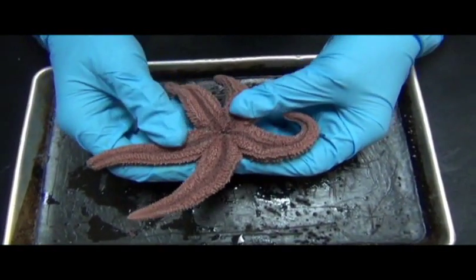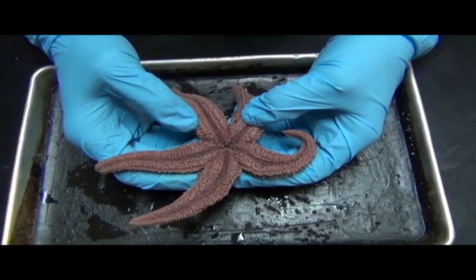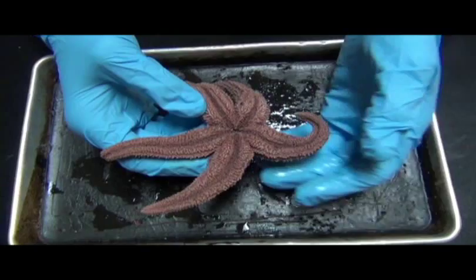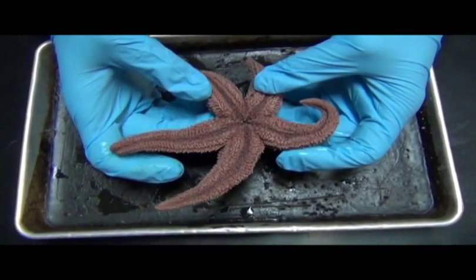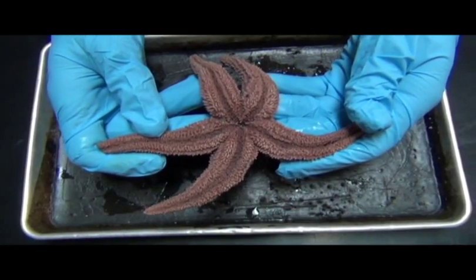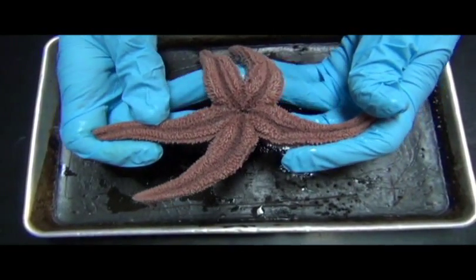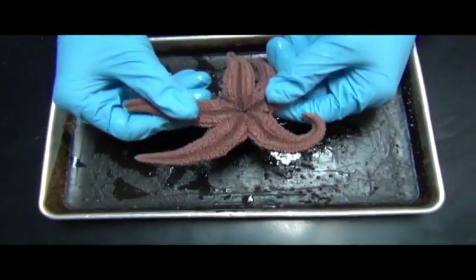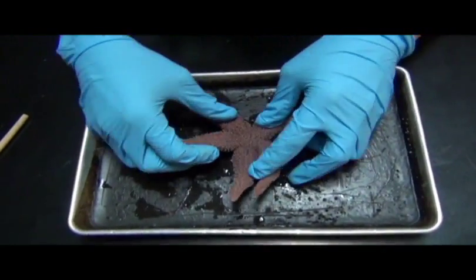And these are echinoderms, and so they have what is called pentaradial symmetry, meaning they're radially symmetrical, but they always have major structures organized in sets of 5. So in the case of the sea star, they have arms in sets of 5. So this guy has 5 arms. Okay. So again, this is the oral surface, and this is the aboral surface.